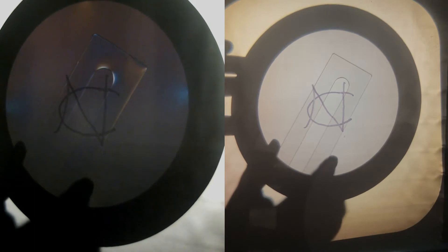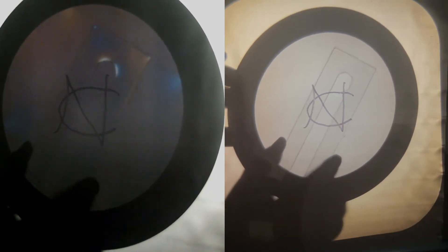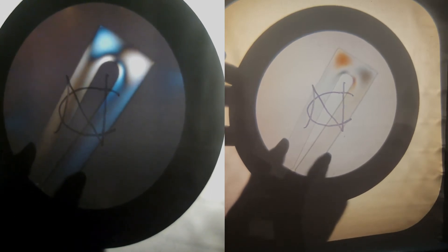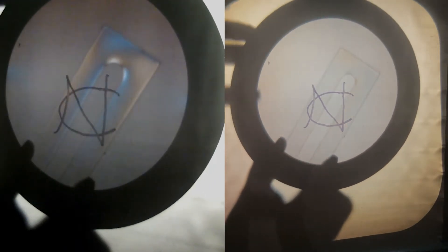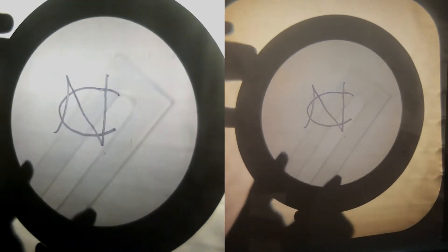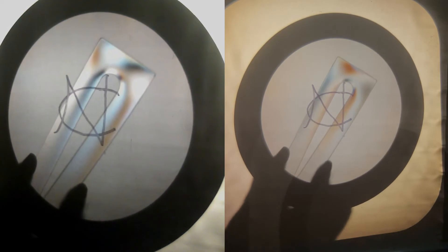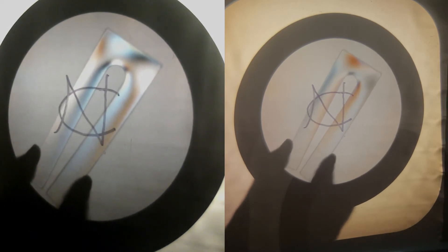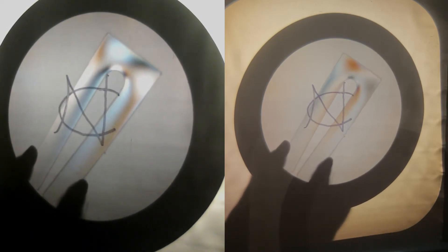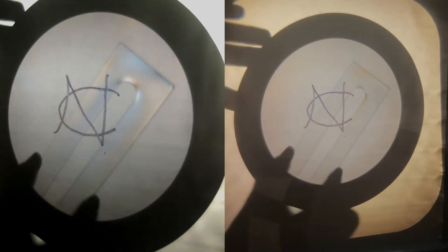So when you have extinction, you see nothing when the acrylic is not under stress, and you see light when it is under stress. And if you rotate it so it's not completely at extinction, you can see that there are also darker regions where the light is being rotated in such a way that it gets blocked by the analyzer in front of our cameras.